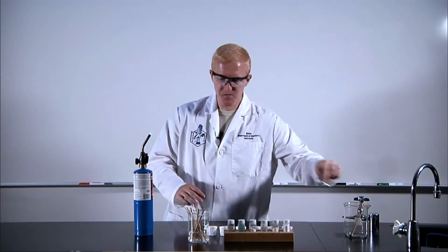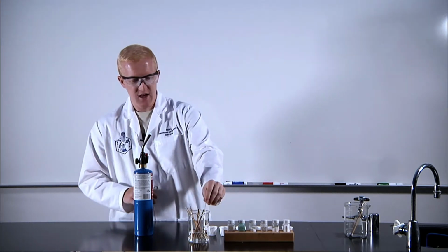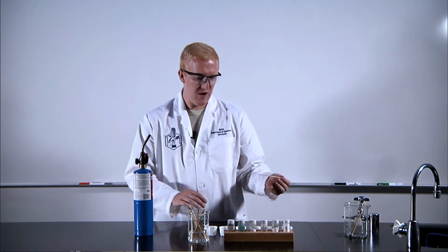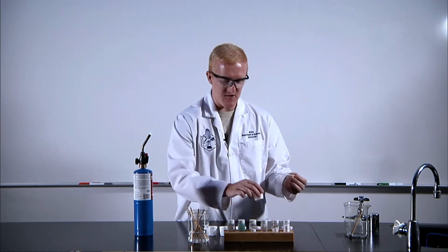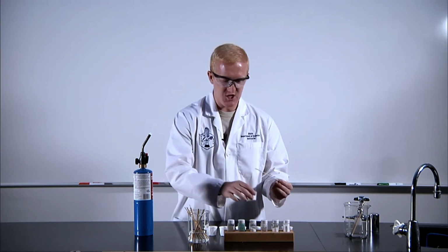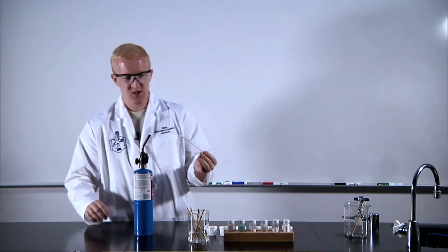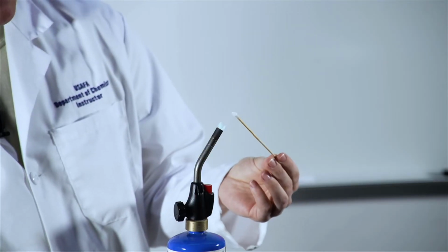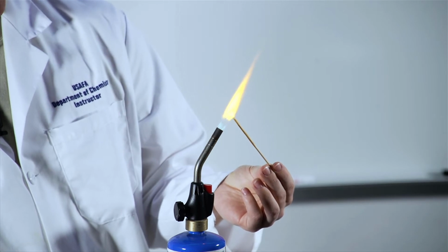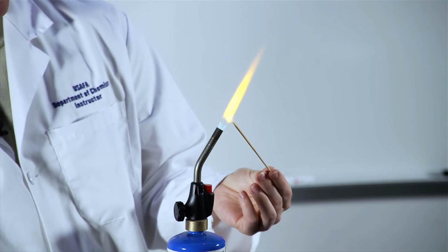So we're going to jump down in the periodic table. Now we're looking at sodium chloride. This is just normal table salt. I would reckon that almost everyone has this in their house. I don't advise trying this at home, but just so you know, this is what this energy transition looks like in sodium. Same thing, when we put that in here, we get this very bright yellow color.